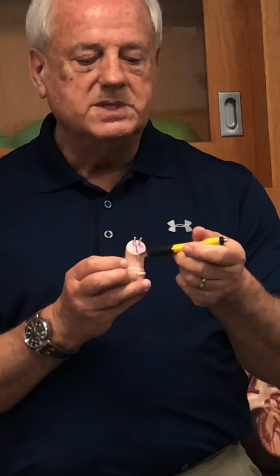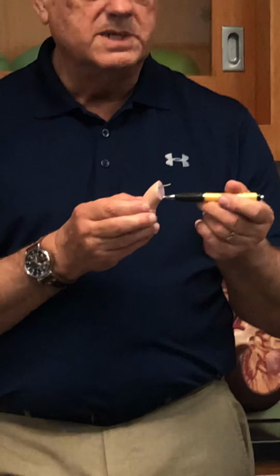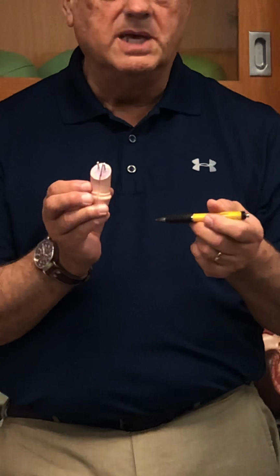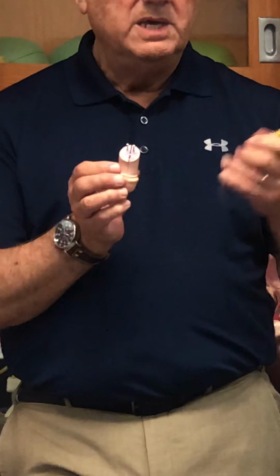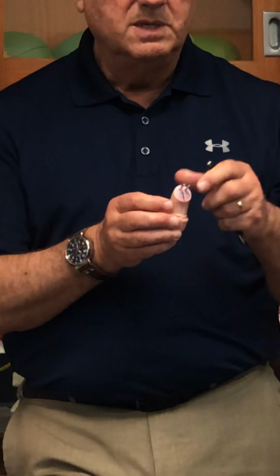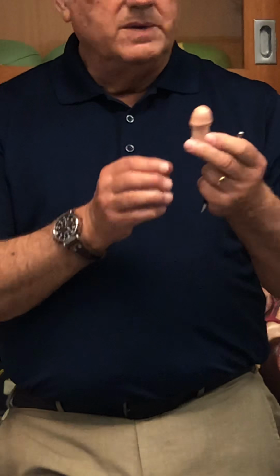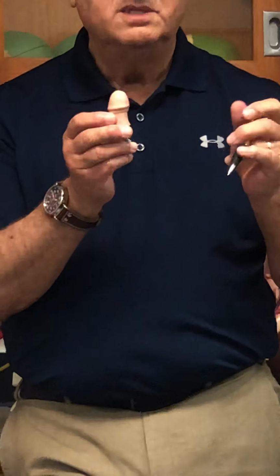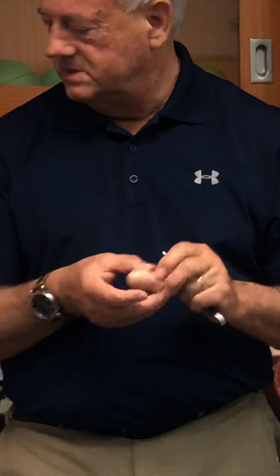This is right here, basically, on this way. You can see the little hole there. That's the spongy urethra, and around it is this specialized tissue. Again, it becomes engorged with blood once an erection takes place, basically. All right, how about the tip of the penis? What's that called? Glans penis.